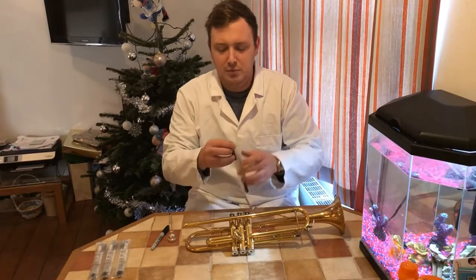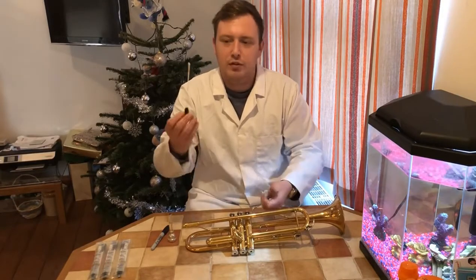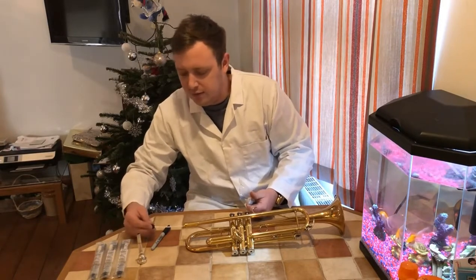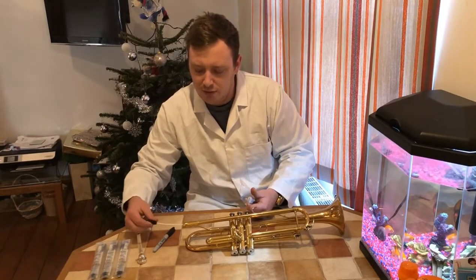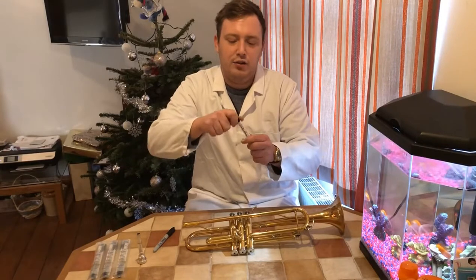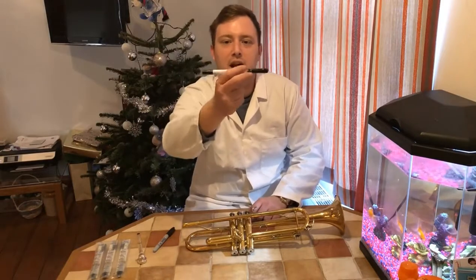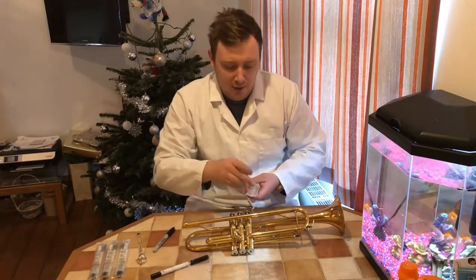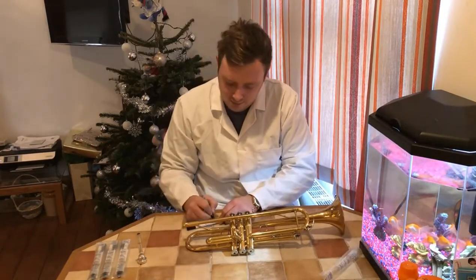To start off, we're going to crack them open and take the swab out. I'm going to swab four different places on the trumpet. So we go inside the lead pipe, give it a nice wipe and pick up all that gunge and rubbish, then put it straight into the tube. That tube has a transport medium inside it — whatever we put in there, it will keep alive until we get to the lab. Then we label it: lead pipe.